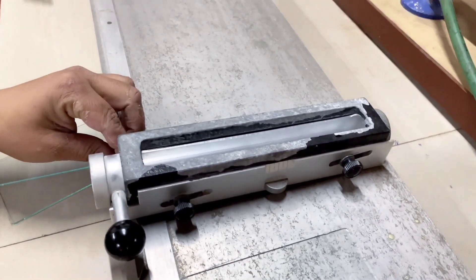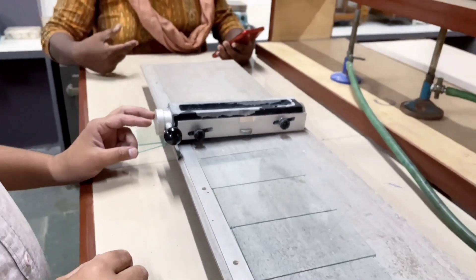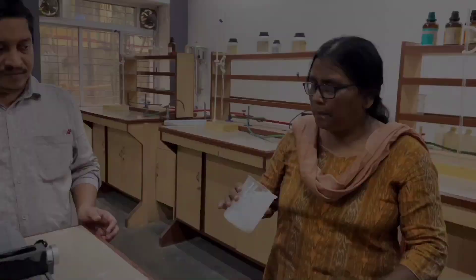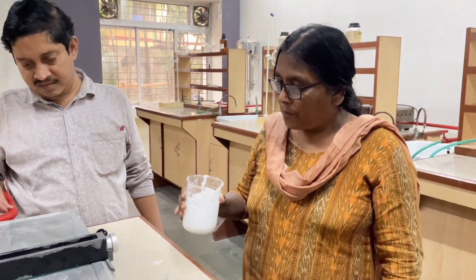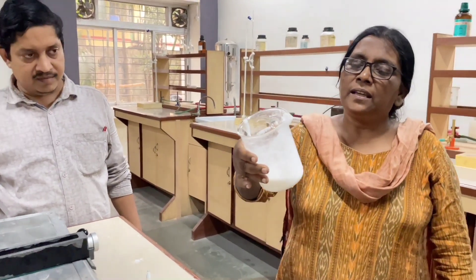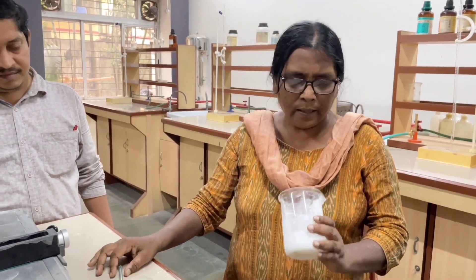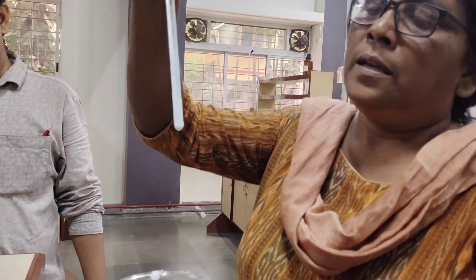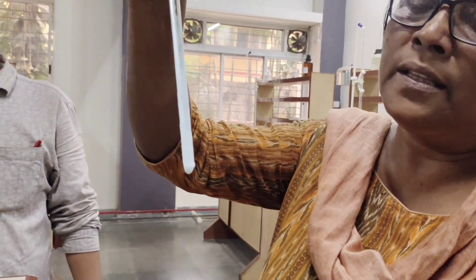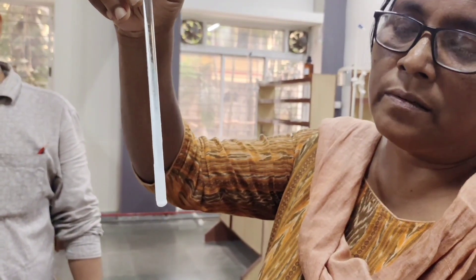The slurry will be made, put into the spreader, and rolled over the plate, pouring the slurry over the glass plate very uniformly. You can see this is the slurry — some silica gel was added to water. It is falling under the attraction of gravity but not very fast; there is substantial stickiness in it.